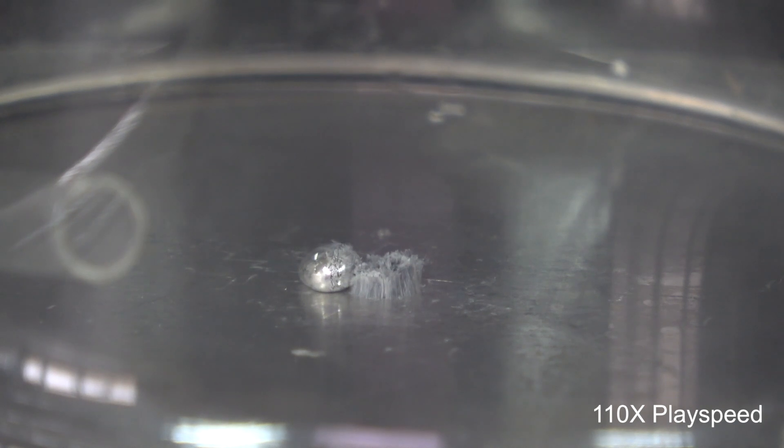The fibers that were grown in a pure oxygen environment appeared to be a lot stronger, as they were able to push the mercury droplets aside.